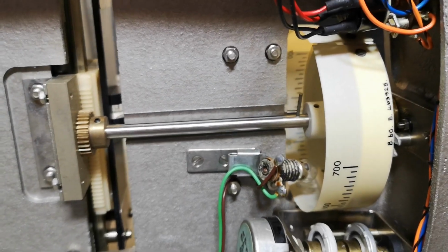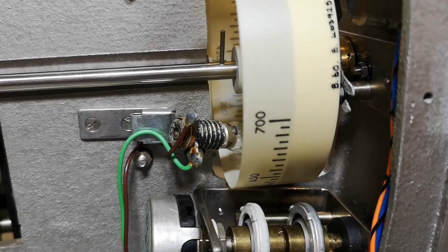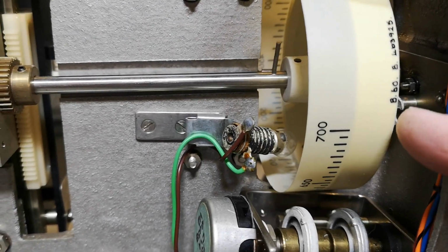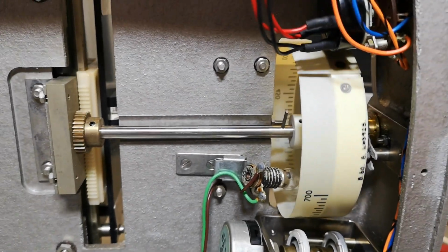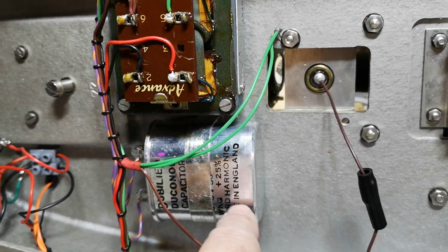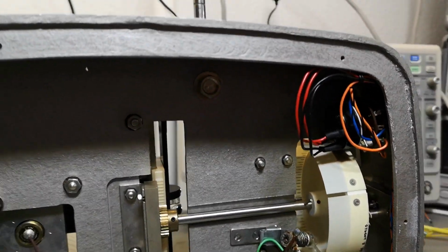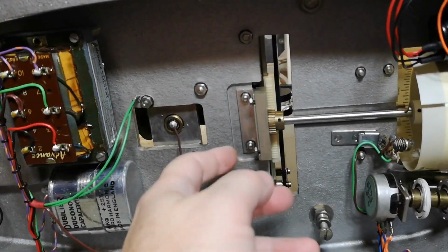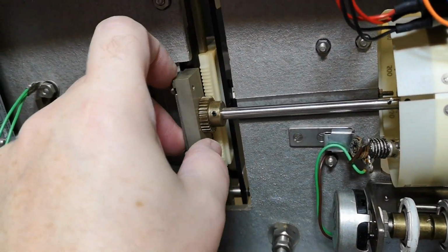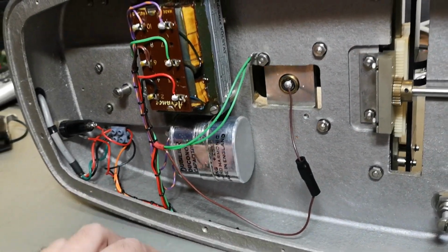Oh, we got some text here. B60, B whatever it is. 860. Probably month and then year, right? Yeah, this thing could definitely be from 1960. You could also be lucky to find dates or years on capacitors. Not on that one. Yeah, but that is all there is about this nice instrument. It's really made with, you know, good quality components, and everything is big and thick, and I mean, this is super good quality.